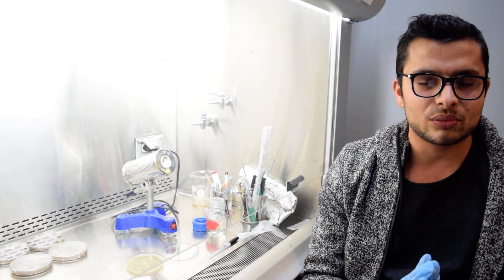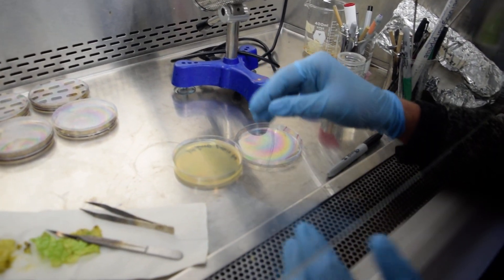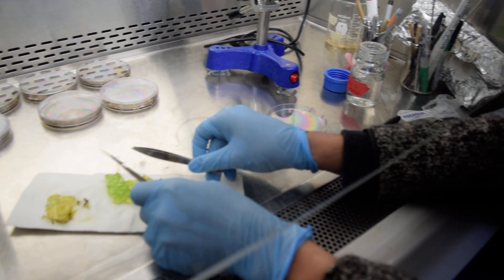We have already prepared the potato dextrose agar media for the experiment, which is here. And now we are entering into the plating method.